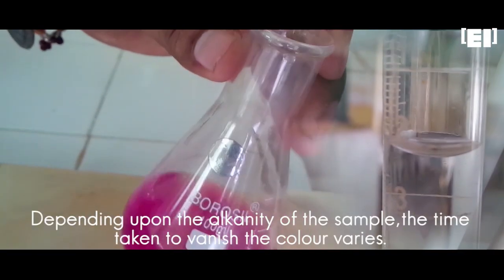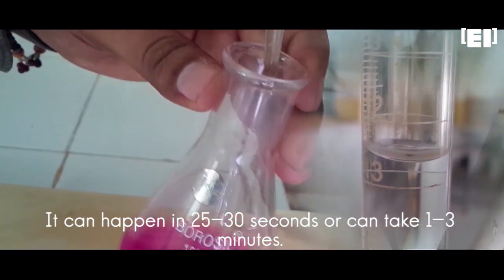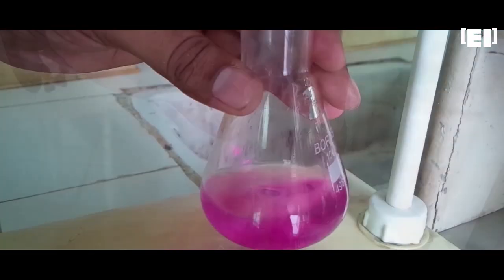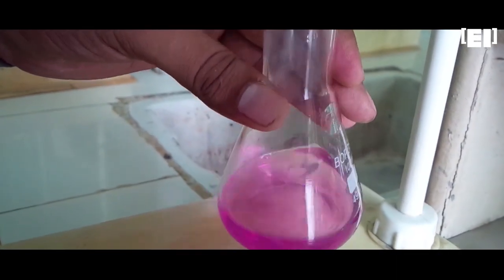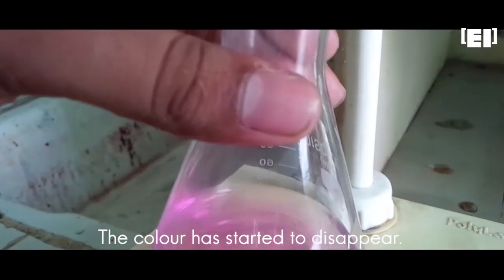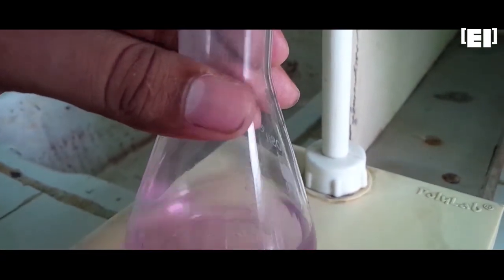Depending upon the alkalinity of the sample, the time taken to vanish the color varies. For example, it can happen in 25 to 50 seconds or can take 1 to 3 minutes. We can see the color is disappearing slowly, so be careful and stop the titration as soon as it dissolves or disappears completely.